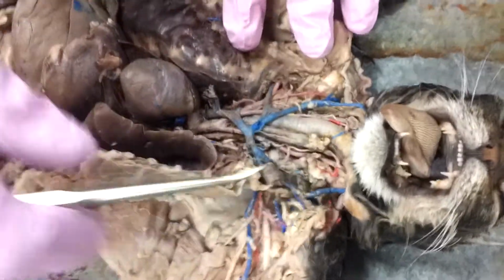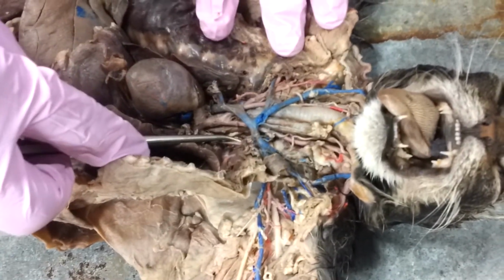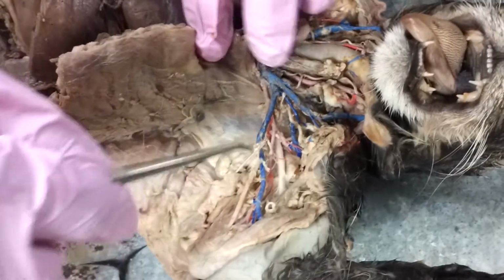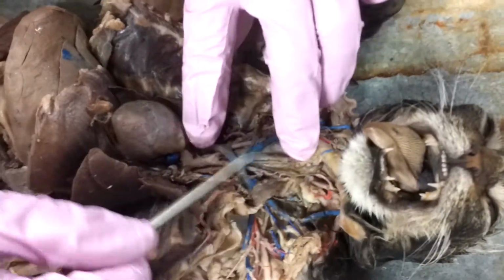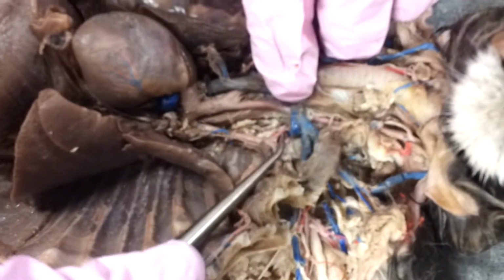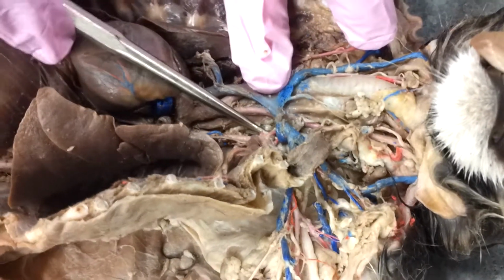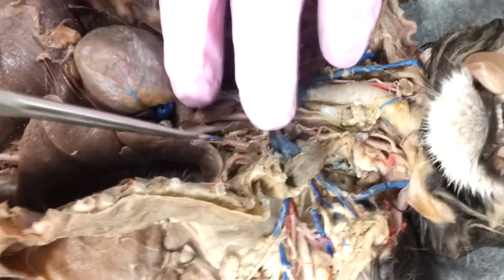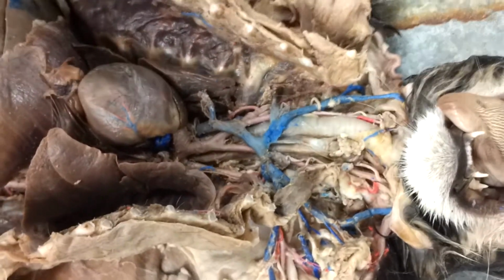The only thing I want to mention here, and it's going to be the same thing on the left side: left subclavian inside, take it on the outside, here's our axillary, and we've got our brachial. The only thing is the first branch off of that subclavian, and we can actually see it in this cat, is going to be that vertebral artery. First I should say it's a hard artery to find, but you can always tell it because it's going to dive down deep. That's that first branch. It dives deep down, and that's going to be our vertebral artery.